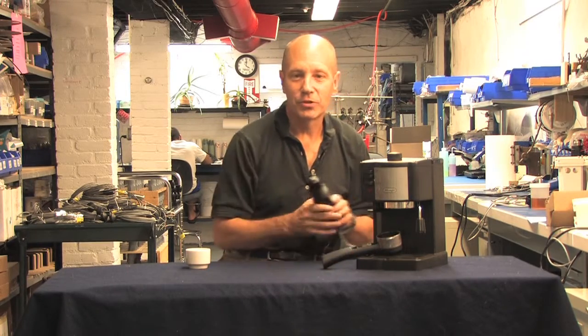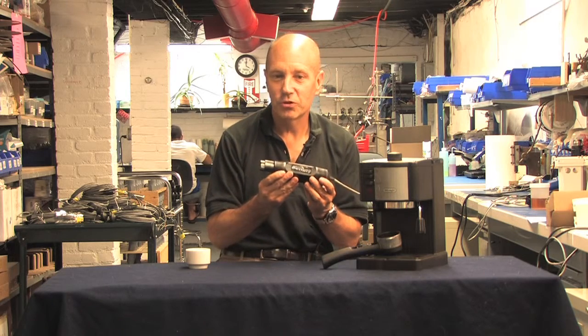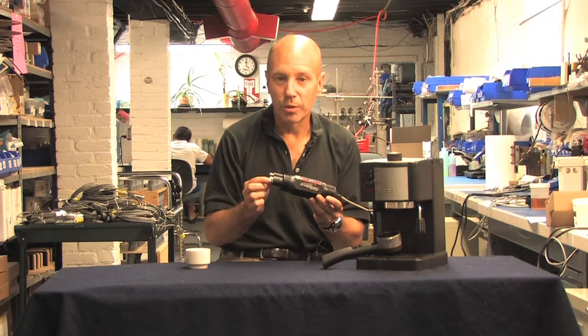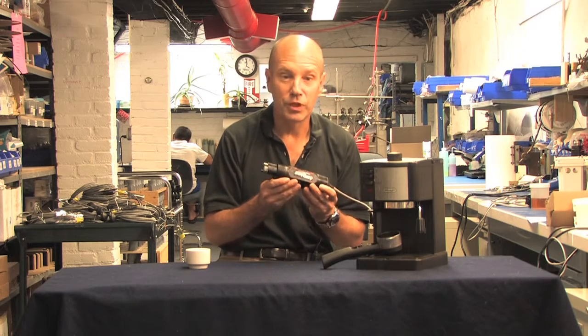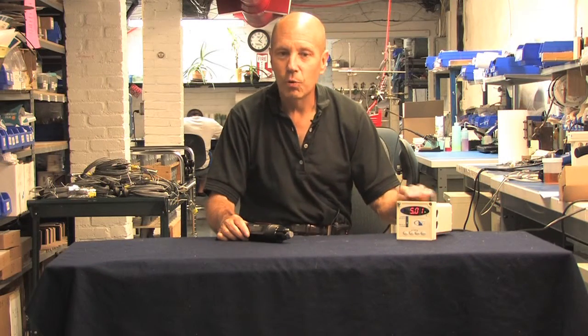The same thing happens with many of our customers in their Aquametrics differential probes. What makes this sensor so special is that simply by replacing the reference solution and the salt bridge a few times a year, it will last for years. I can't tell you how many times I've talked to an end user who discarded a perfectly good sensor simply because he thought it had expired, when in fact all it needed was 5 minutes of inexpensive maintenance. In this video, I'll walk you through basic maintenance that will keep your Aquametrics differential probe working for years.